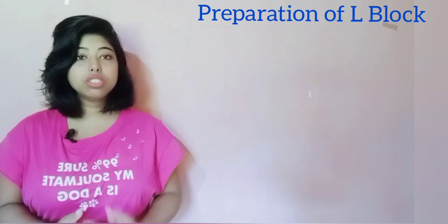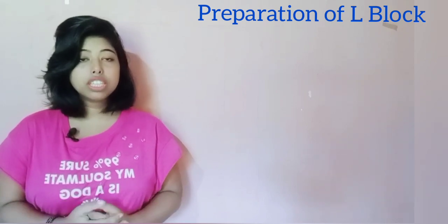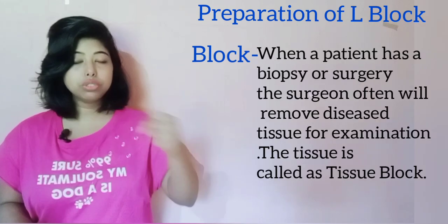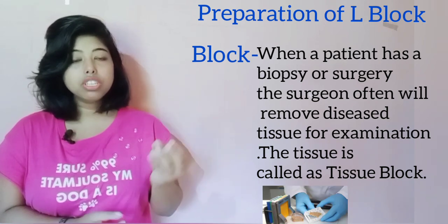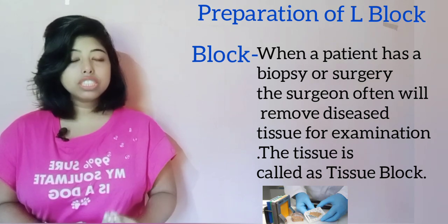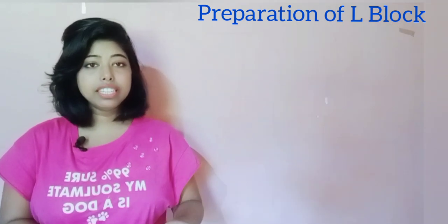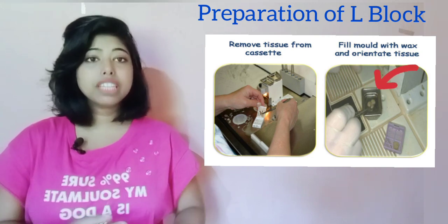Now we will see the two most important words: L-block formation, or the preparation of a block. What is produced in the embedding procedure is the preparation of the block. To describe what a block is — after we do biopsy and take out a tissue, this tissue is moved to the lab for examination. That particular tissue is called the block or tissue block. We prepare this block for section cutting through the embedding procedure. Earlier I mentioned we add tissue specimens to hot liquid wax in a tray — but that tray is actually not a tray.